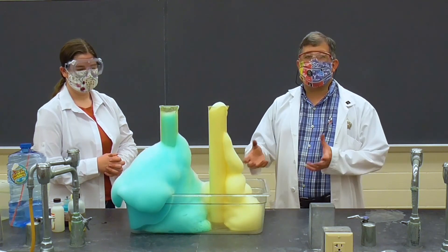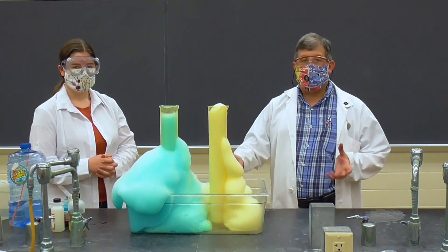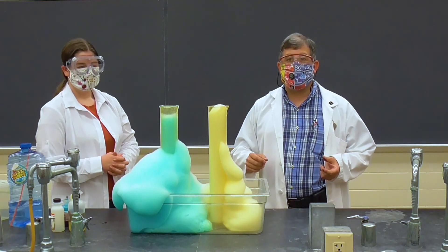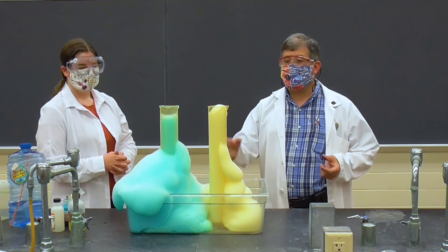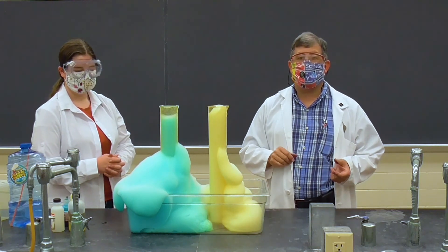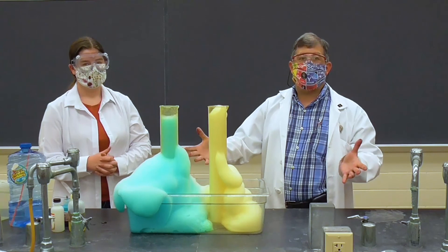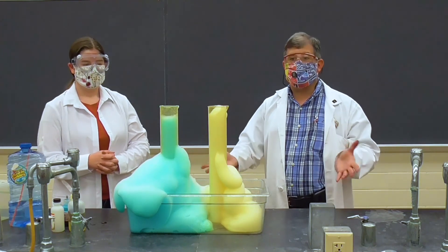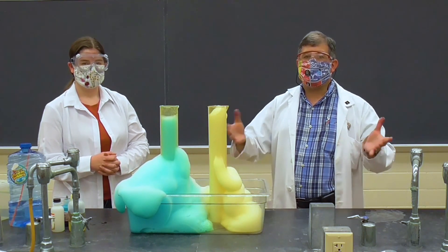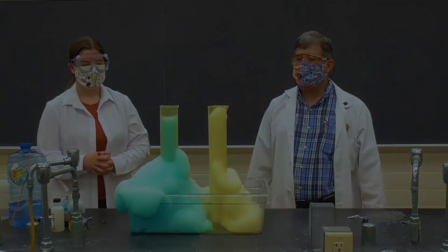What happens is the sodium iodide causes the hydrogen peroxide to decompose, giving off oxygen gas. That oxygen gas blows bubbles into the bubble soap, so it comes foaming out — it looks thick like toothpaste and there's a lot of it. That's why it's called elephant toothpaste.